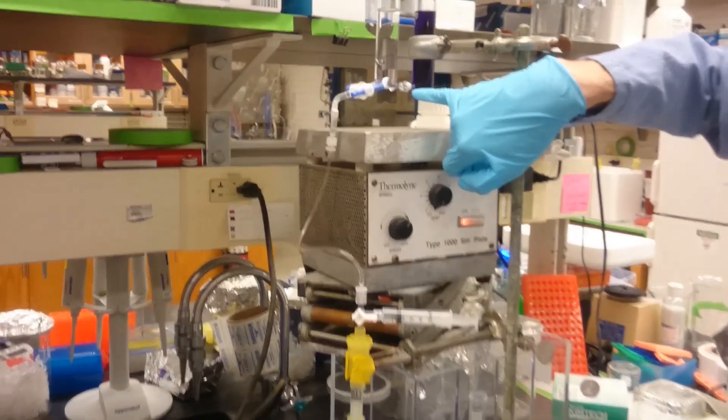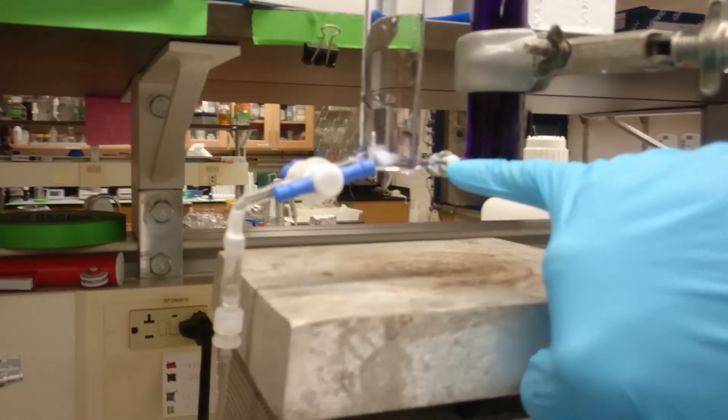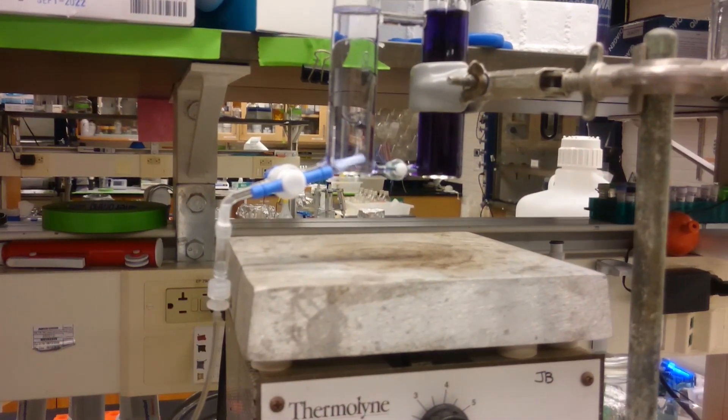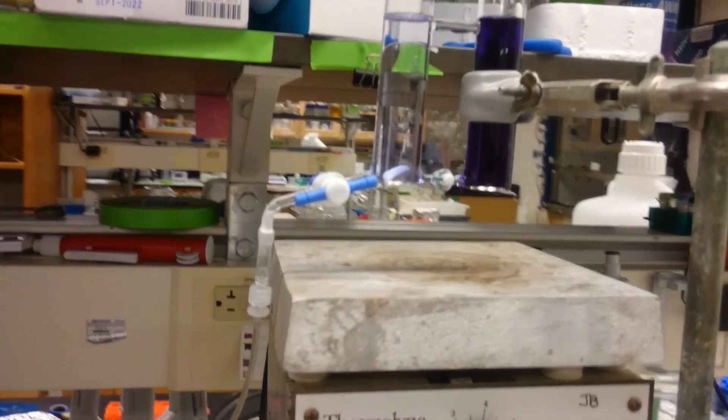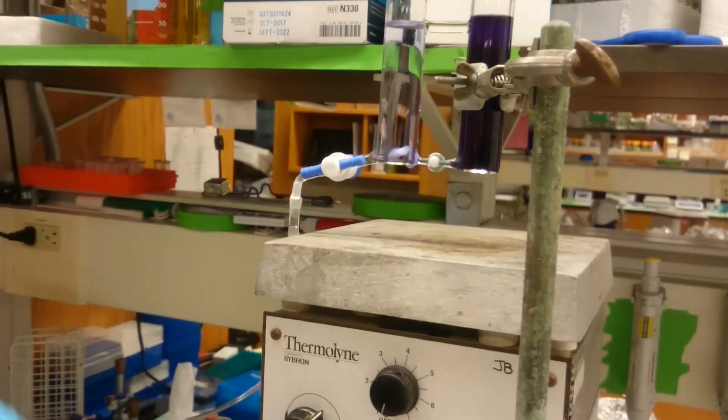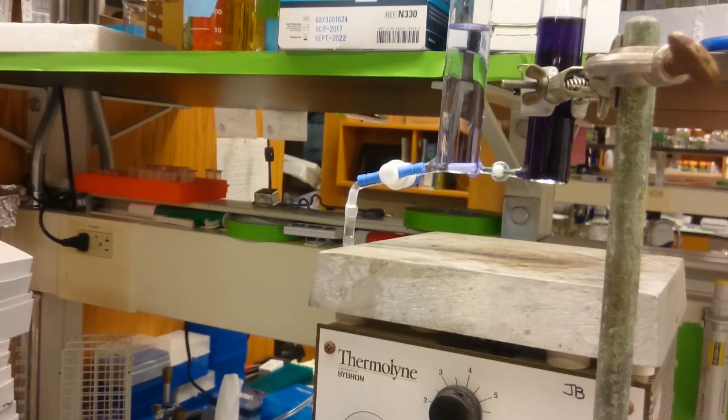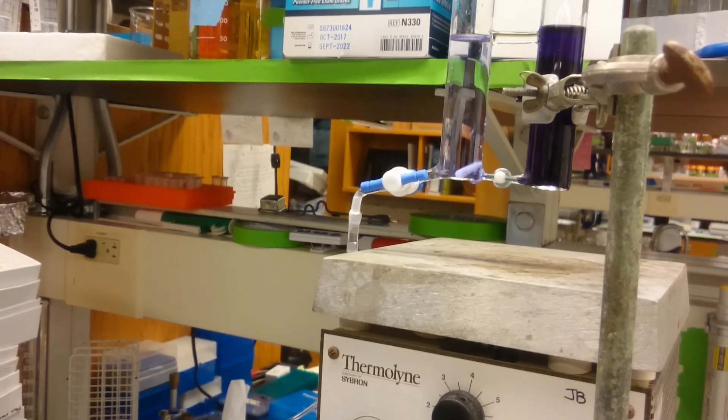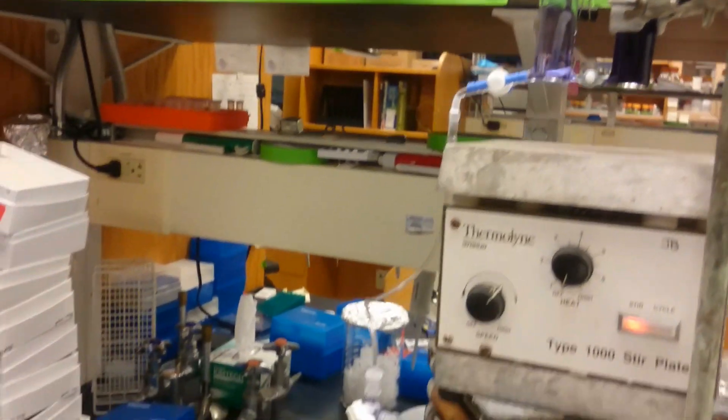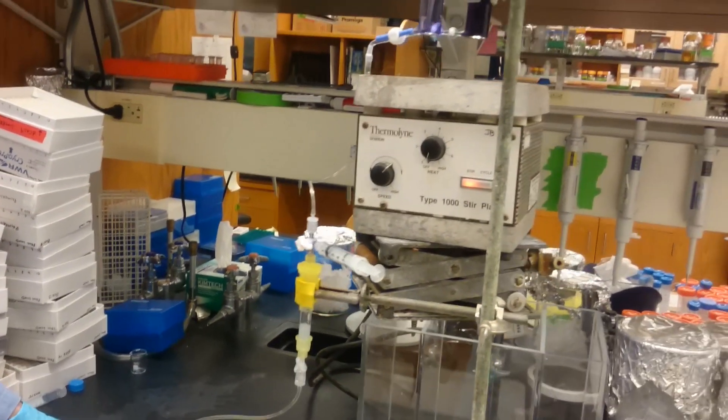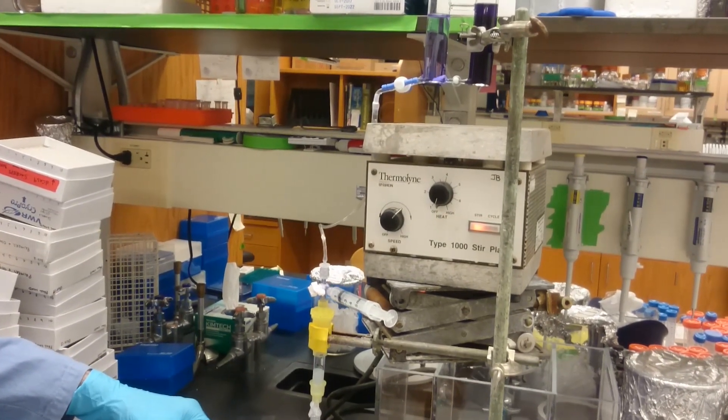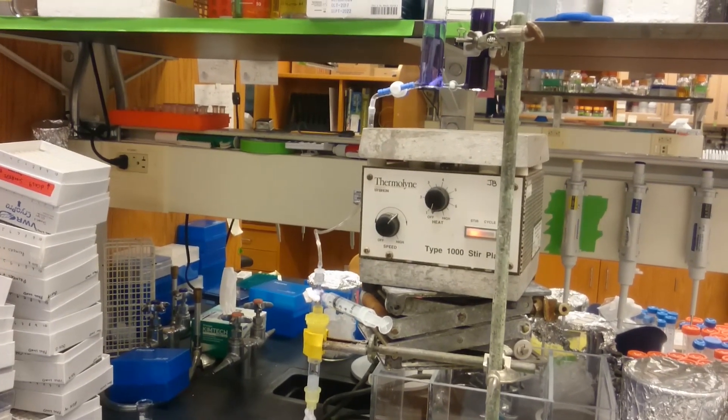And so then if you come in closer and look at this here, you can see that these two things are starting to mix. You can see that there's purple stuff coming in from here into the mixing chamber as it's coming through here.